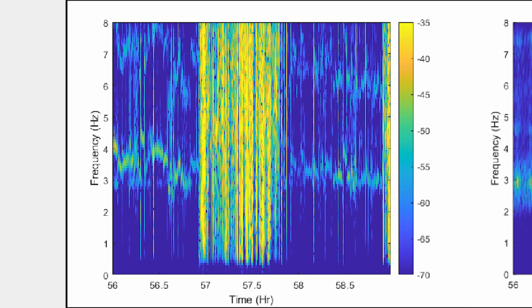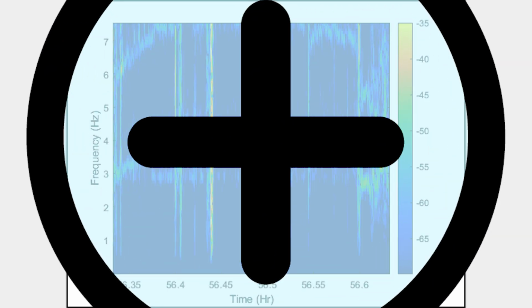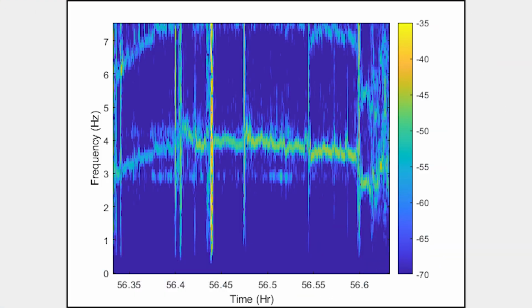From viewing the 3-hour interval spectrogram, we see a breathing signature in cage 1. However, we do not see bands for the noise signatures that are apparent in the empty cage. Now we will zoom in on the spectrogram for the first top shelf cages just after hour 56. We can see the spectral pattern for the breathing signal, and we can also see a constant 3 Hz signal, which is consistent with the noise signal in the empty cage.